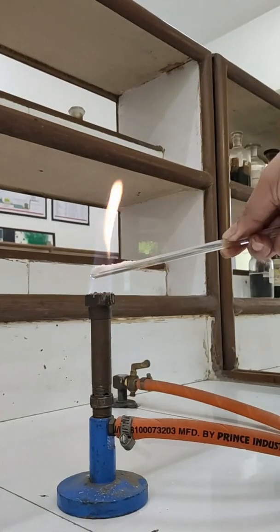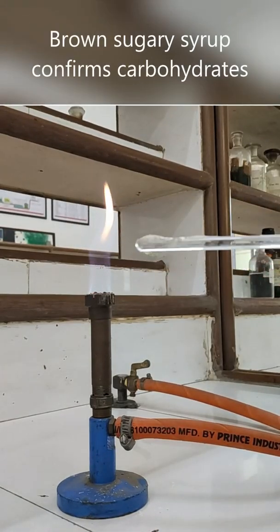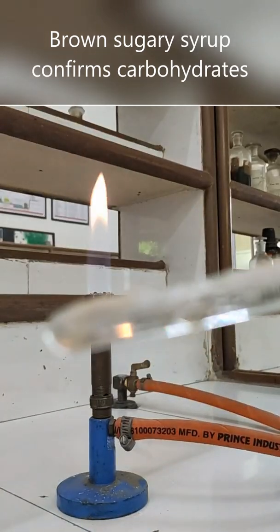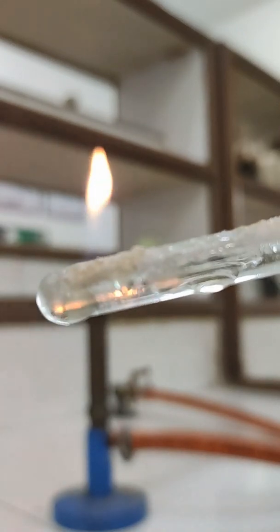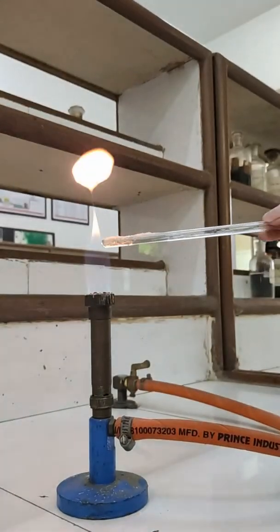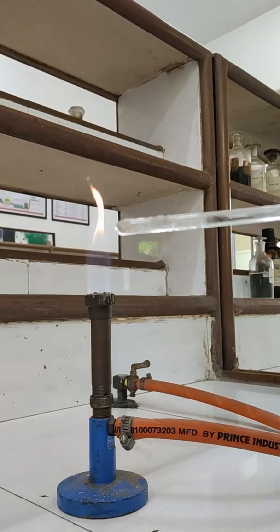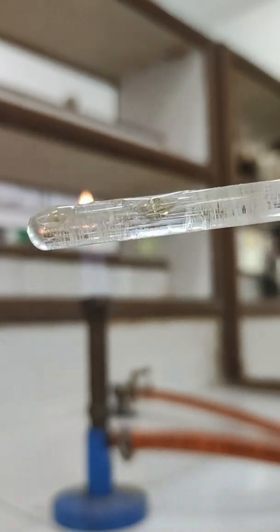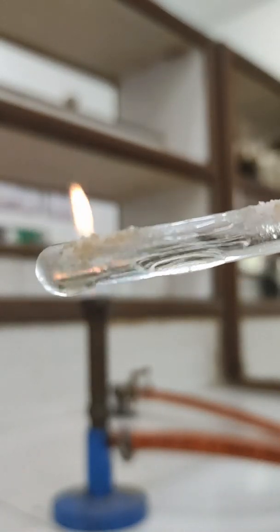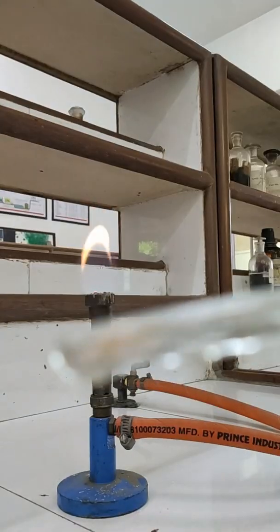Now coming to the third compound — what I have taken is glucose. Here you can see it is giving a light brown shade. The compound is melting with a light brown syrup kind of thing and it gives a little bit of sound also. This is neither giving you black flame nor white flame, rather a brownish syrupy kind of mass. This is known as charring and this is a carbohydrate compound — so this confirms that the compound is a carbohydrate.